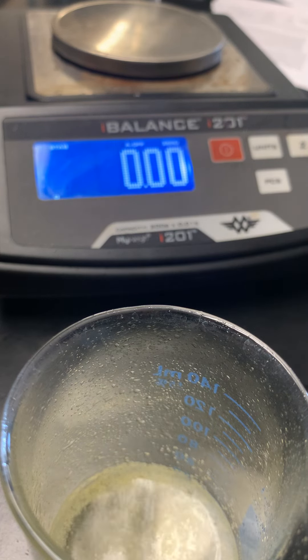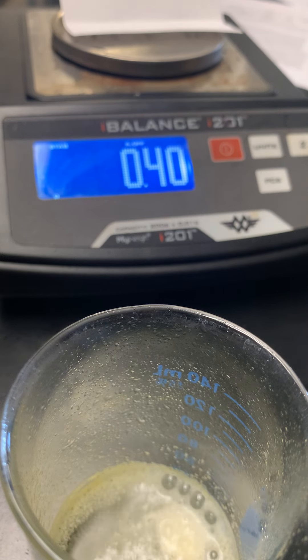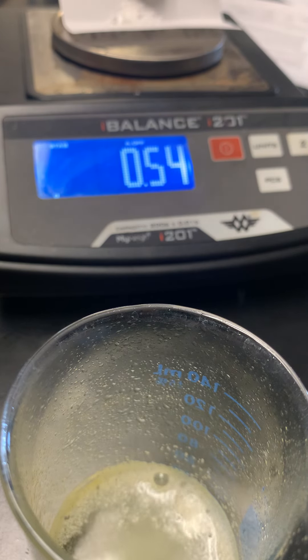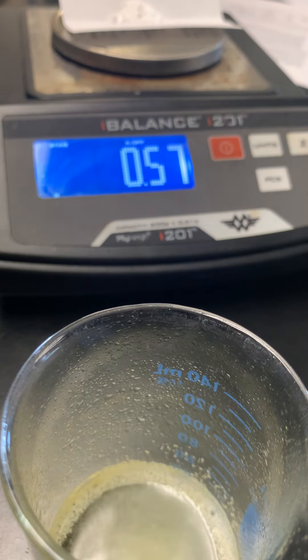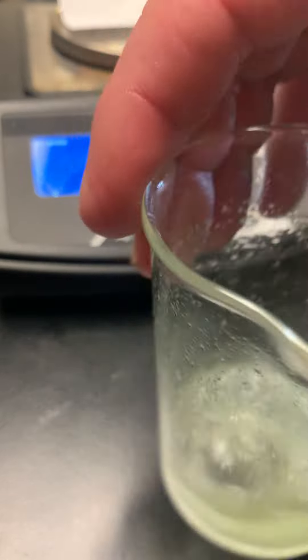Meanwhile, we'll mass out the citric acid. It turns out the reaction does not finish on its own, and we're going to need to add more citric acid to drive the reaction to completion. We're supposed to add between 0.5 and 0.7g, so we add 0.57g. The mixture gets cold and really fizzy, and then as the reaction approaches completion you can see the color starting to go back to green.